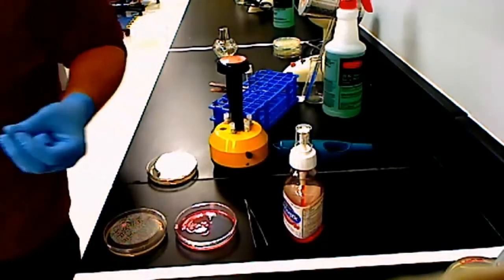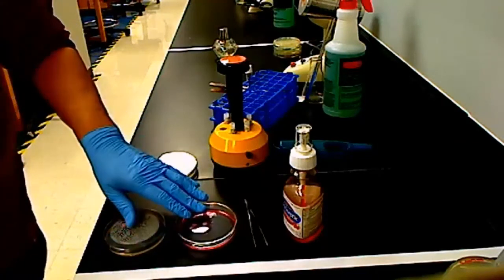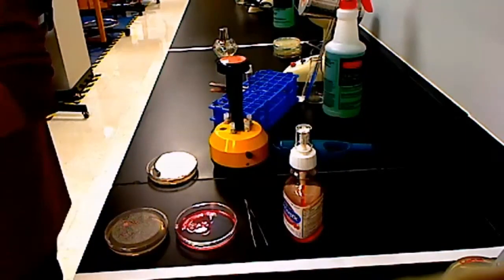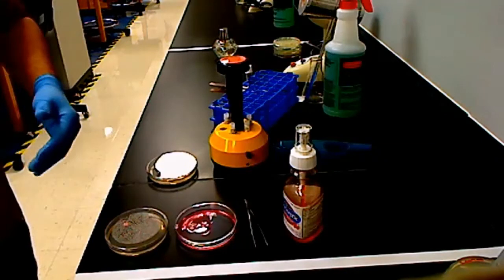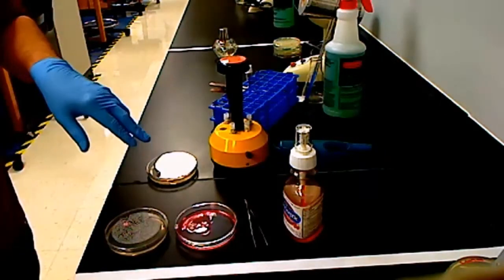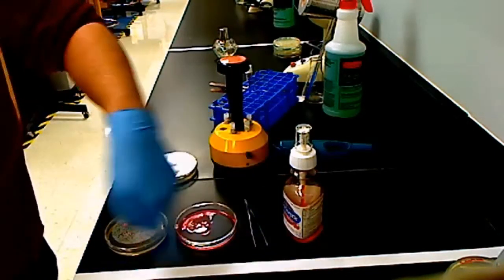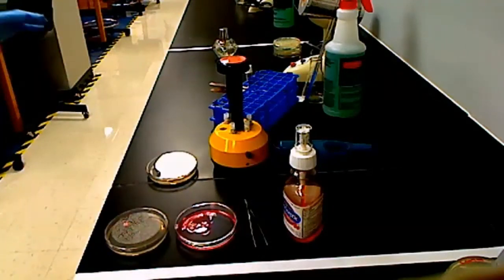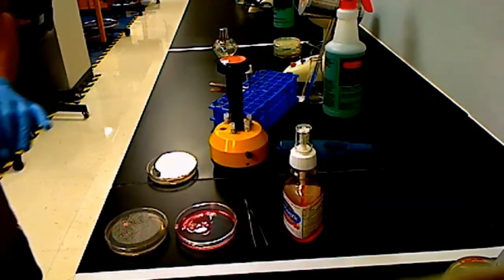When we look at the disinfectant stations, which are going to be on the other side of the classroom, you're going to see that there are actually 2 disinfectants per station. Okay, right now I have bleach and Listerine at one station, and then hydrogen peroxide and Pine-Sol at the other, but it may be different for your class. Even though there are 2 different disinfectants, there's only going to be 1 person at that particular station. And the stations are all outlined by these little white pieces of tape. So just make sure that you give the people that are working at those stations enough room. Get out of the sterile field whenever they're working in those sterile fields. Okay? And that's going to be it for this demo.